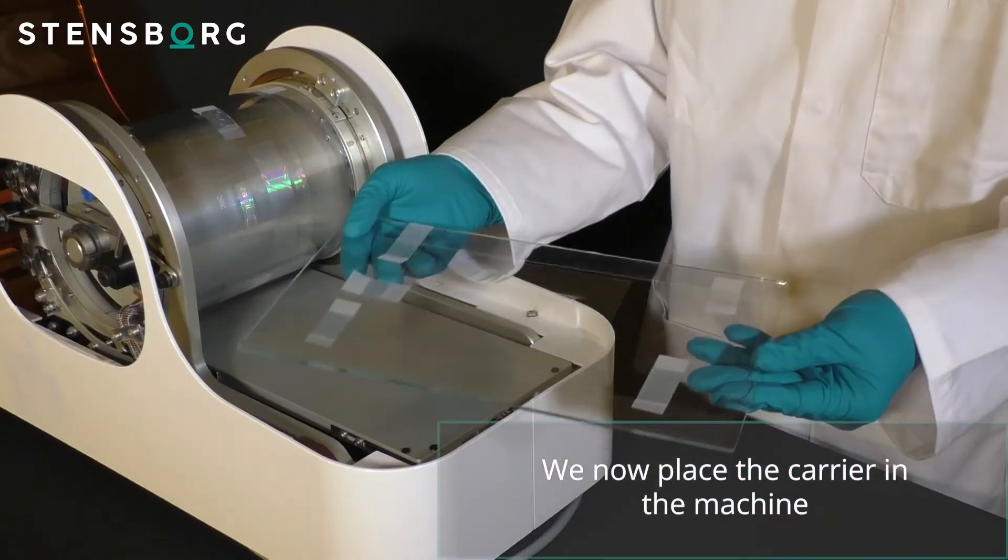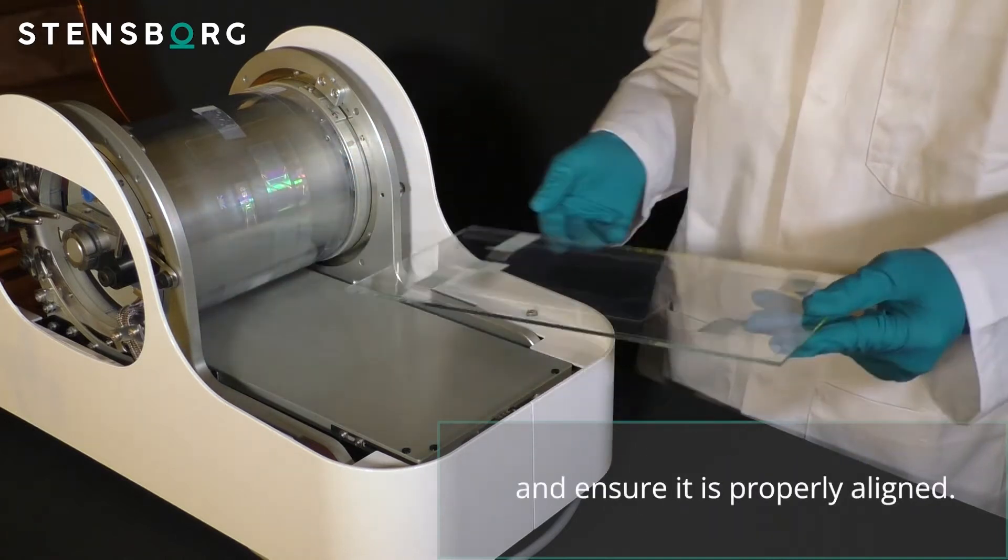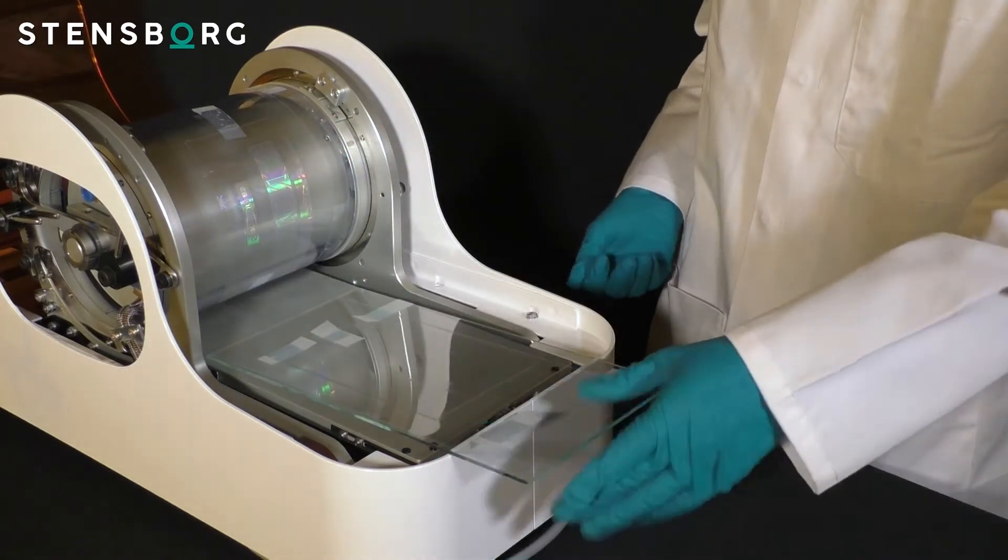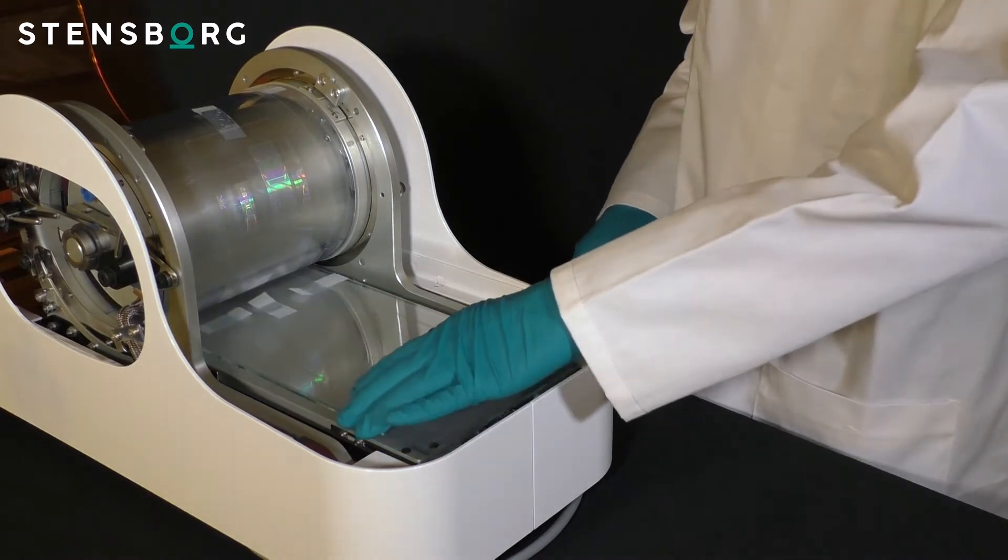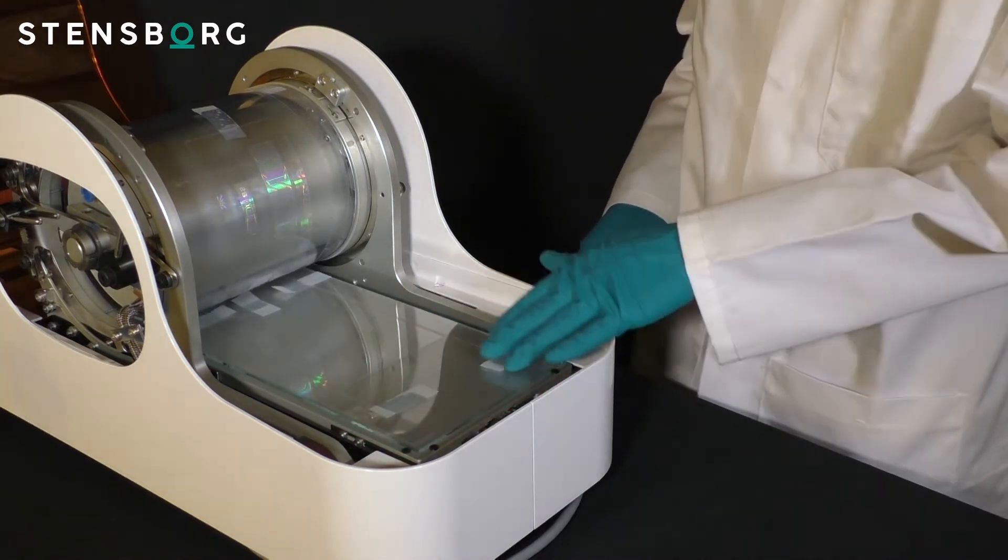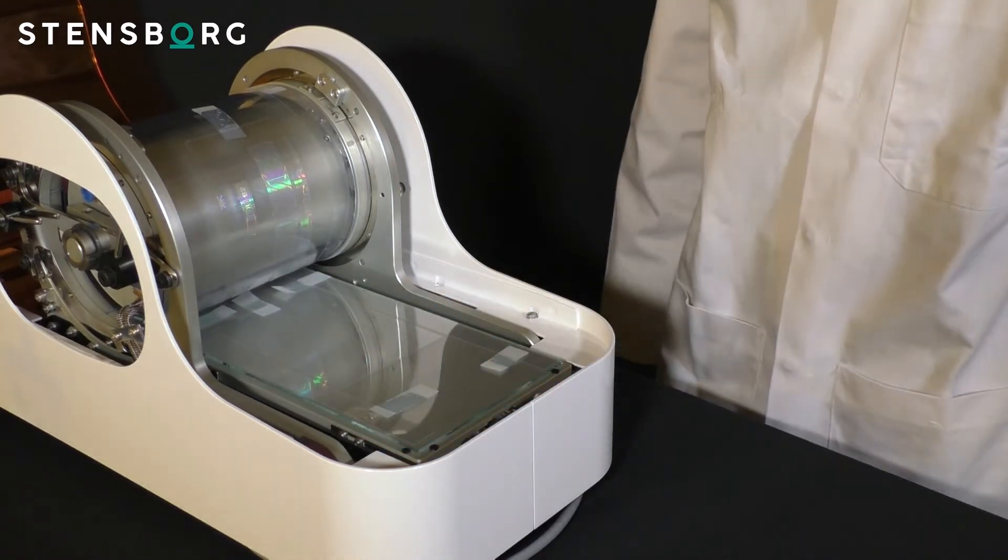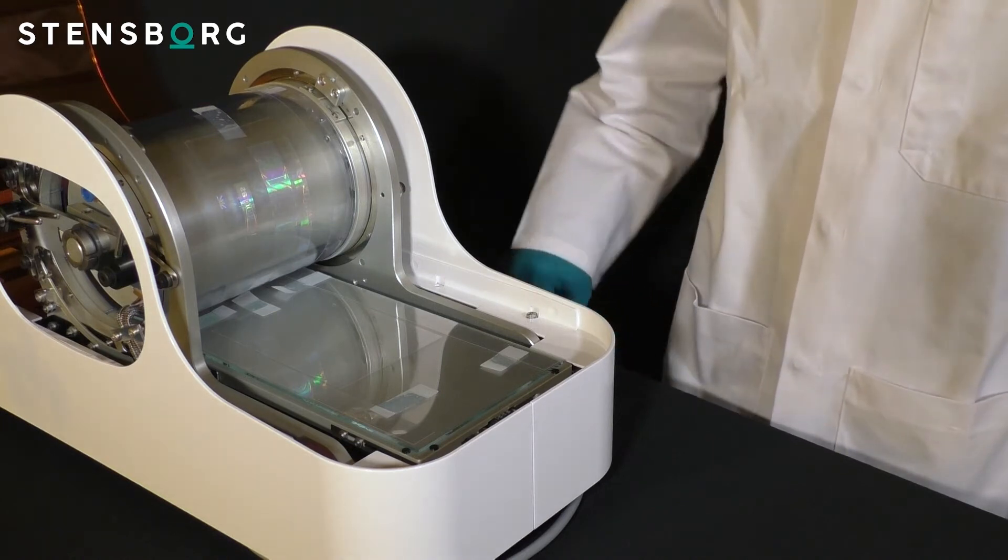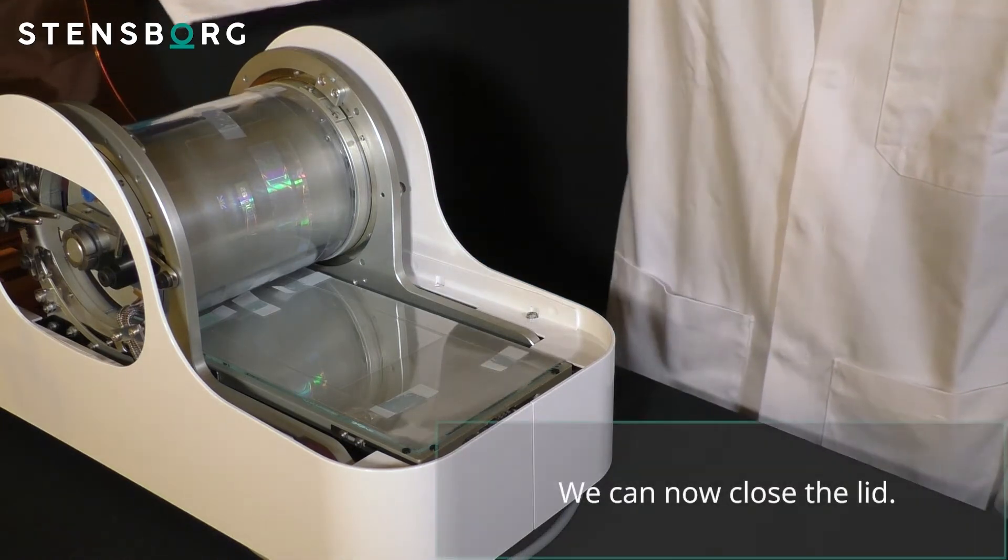We now place the carrier in the machine and ensure it is properly aligned. We can now close the lid.